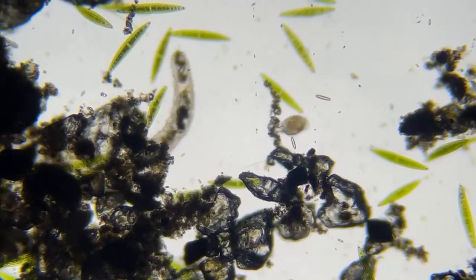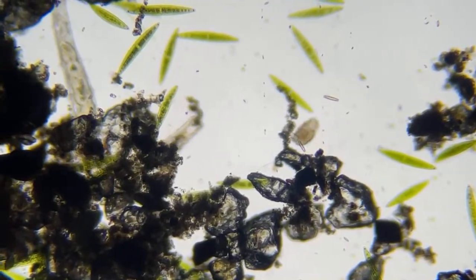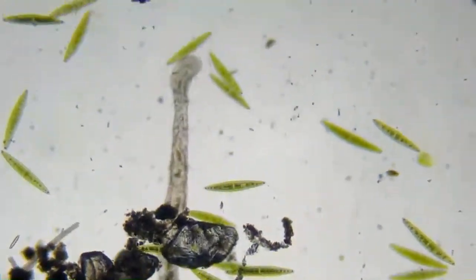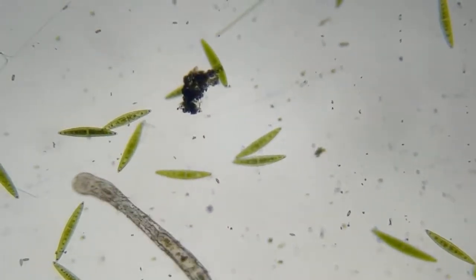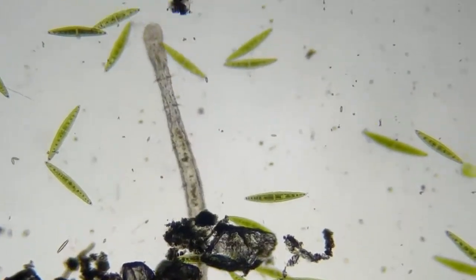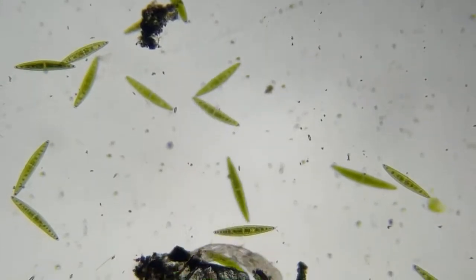I would always recommend, even if your budget's inexpensive, $100 or $50 or $300, always, always save up enough. This is just my opinion. You could see this guy right here with a $50 microscope, okay?